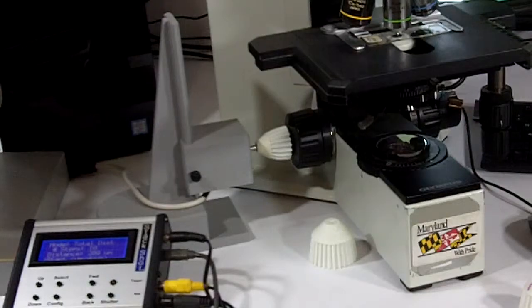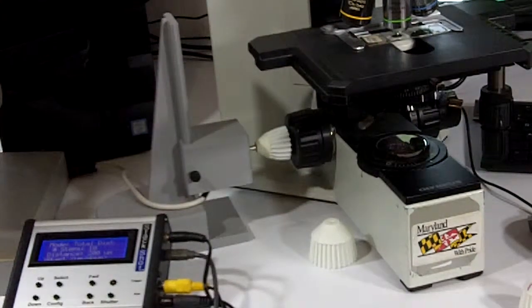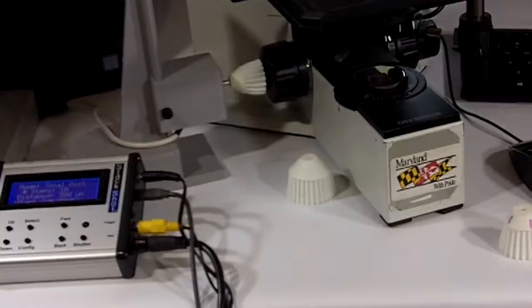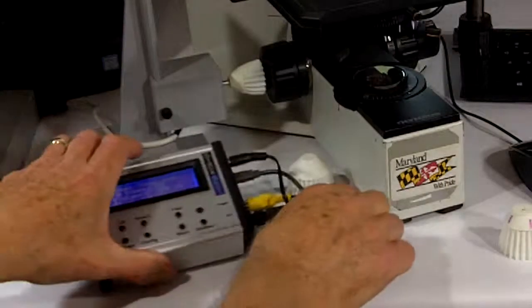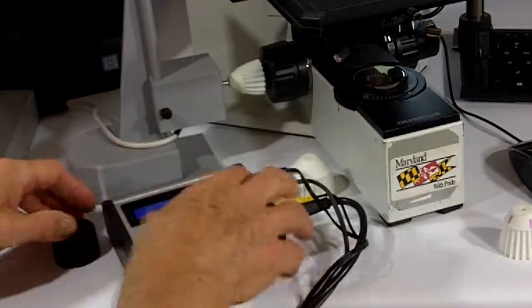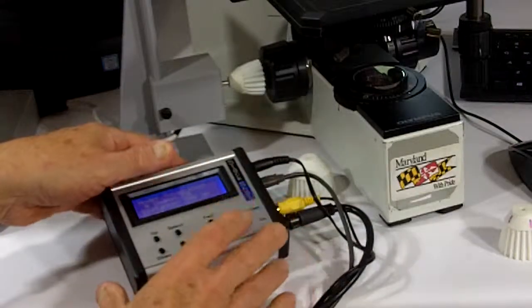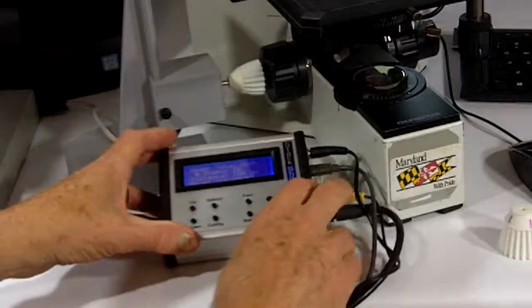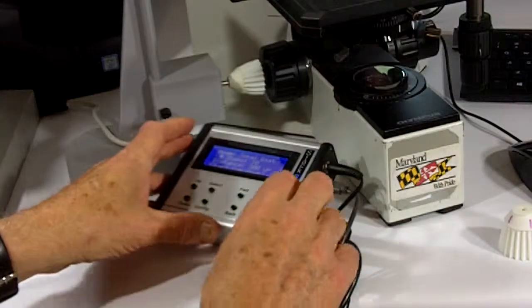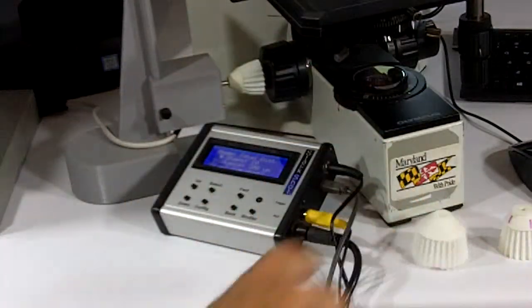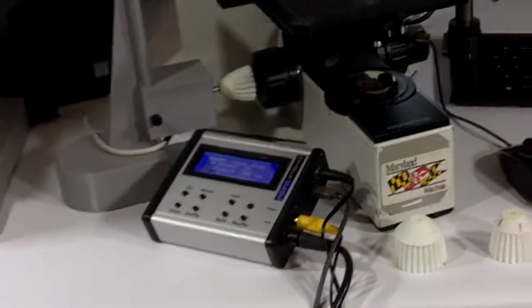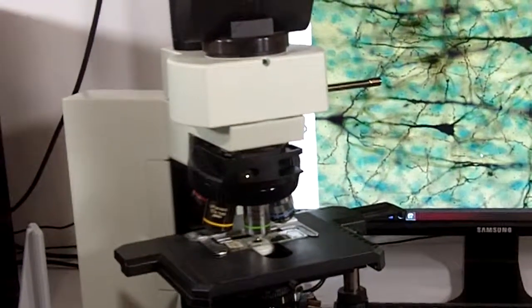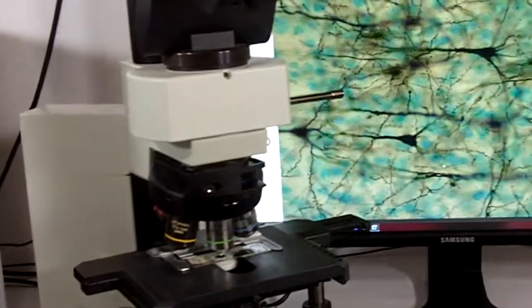Now when we use the unit in real-time mode, put the control unit over here so we can see it. I've got the StackShot set up, and then we have a screen over here.